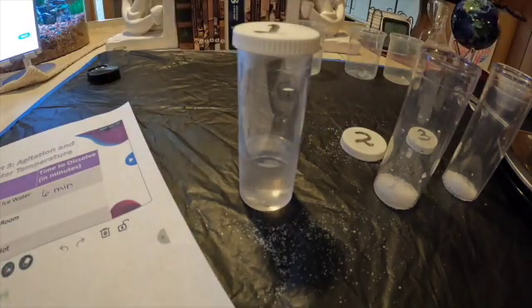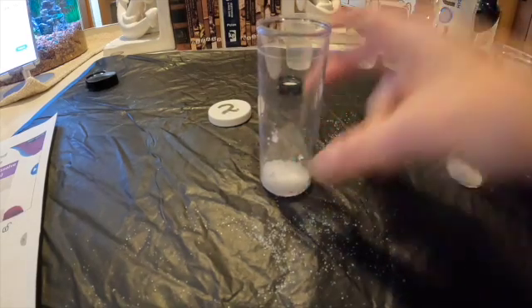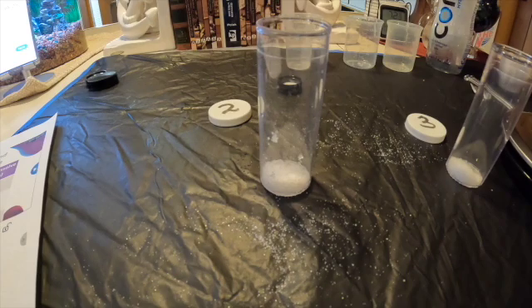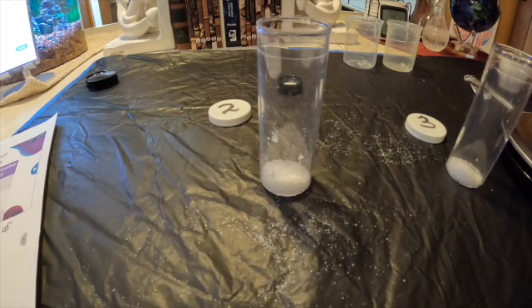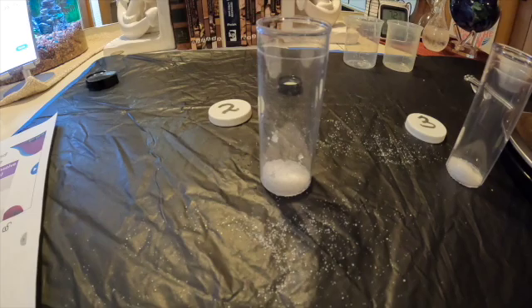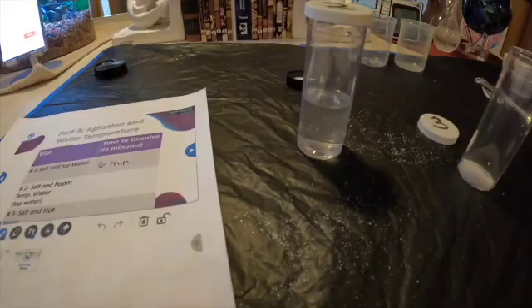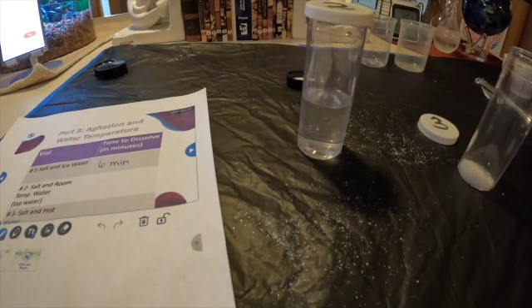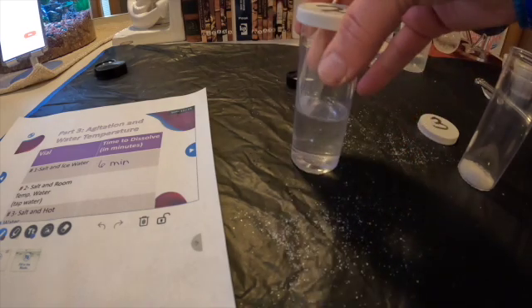The next one we're going to do is salt in room temperature water. In vial two, we still have coarse grain salt and we're going to add 20 milliliters of room temperature water. We're going to do the same process — agitating for five seconds per minute — and see how many minutes it takes to fully dissolve. For vial number two with the salt and room temperature water, it took approximately four minutes for it to fully dissolve. We're going to record that in our chart.